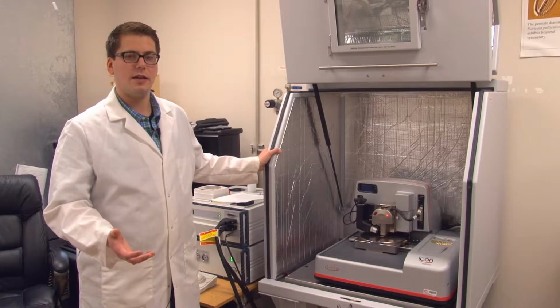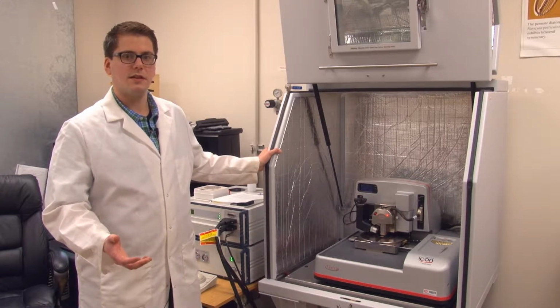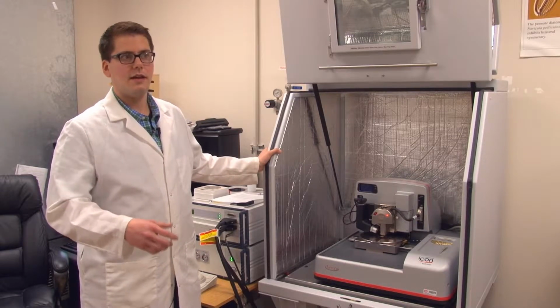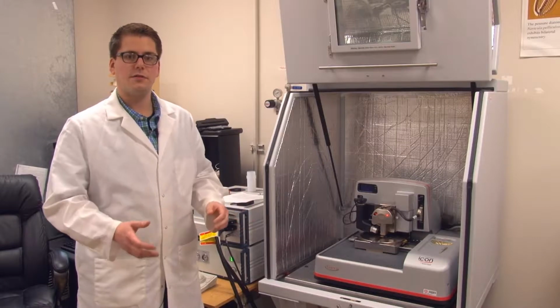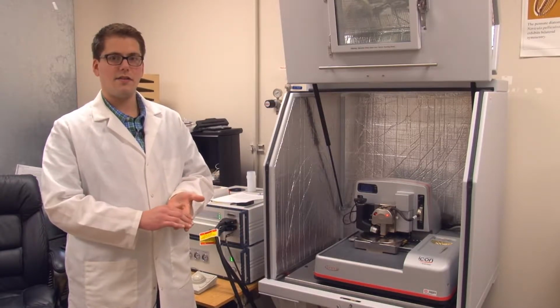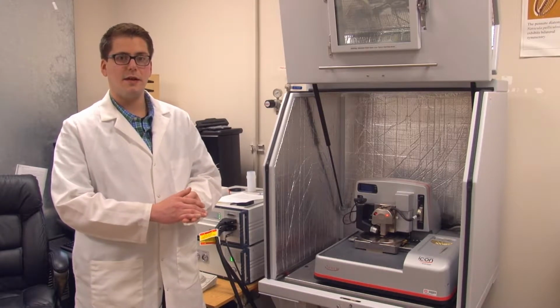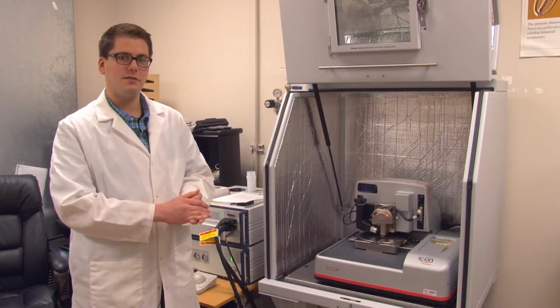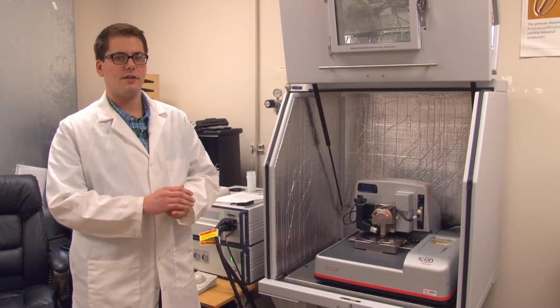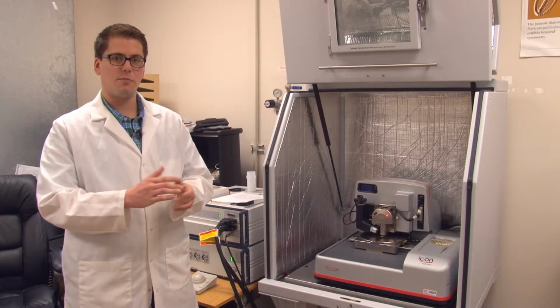We need a well-characterized tip in order to gain useful information about the forces that are associated with the nanoindentation. In order to calculate the force associated with each indentation, we need to know what the spring constant of the cantilever is, and we need to know what the penetration depth of the tip into our sample of interest is. The spring constant of the cantilever is either given by the manufacturer or can be validated through a straightforward approach.